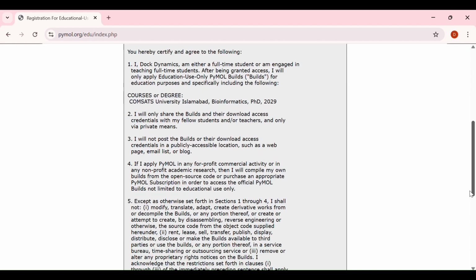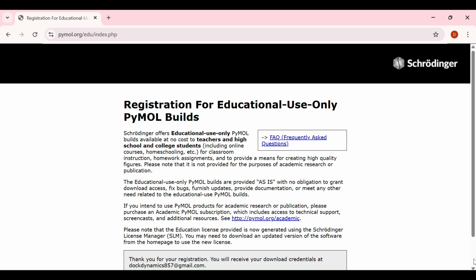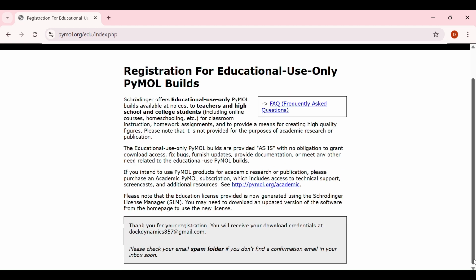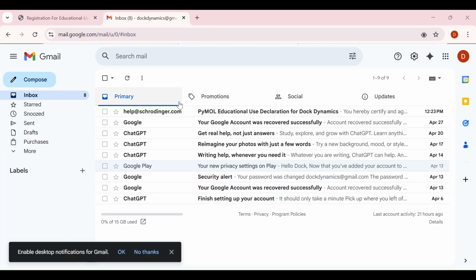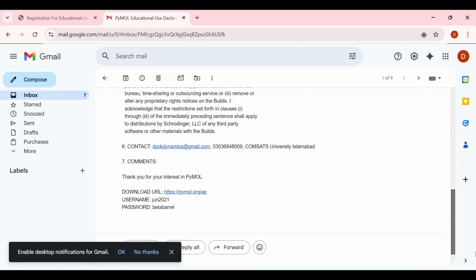Here you have to add the captcha and then click on the I agree button. They just send you an email. Check your inbox, otherwise check the spam folder for the confirmation email. Here you can see that I just received an email from Schrödinger. Inside this email, I will get the license file or the link, URL link.